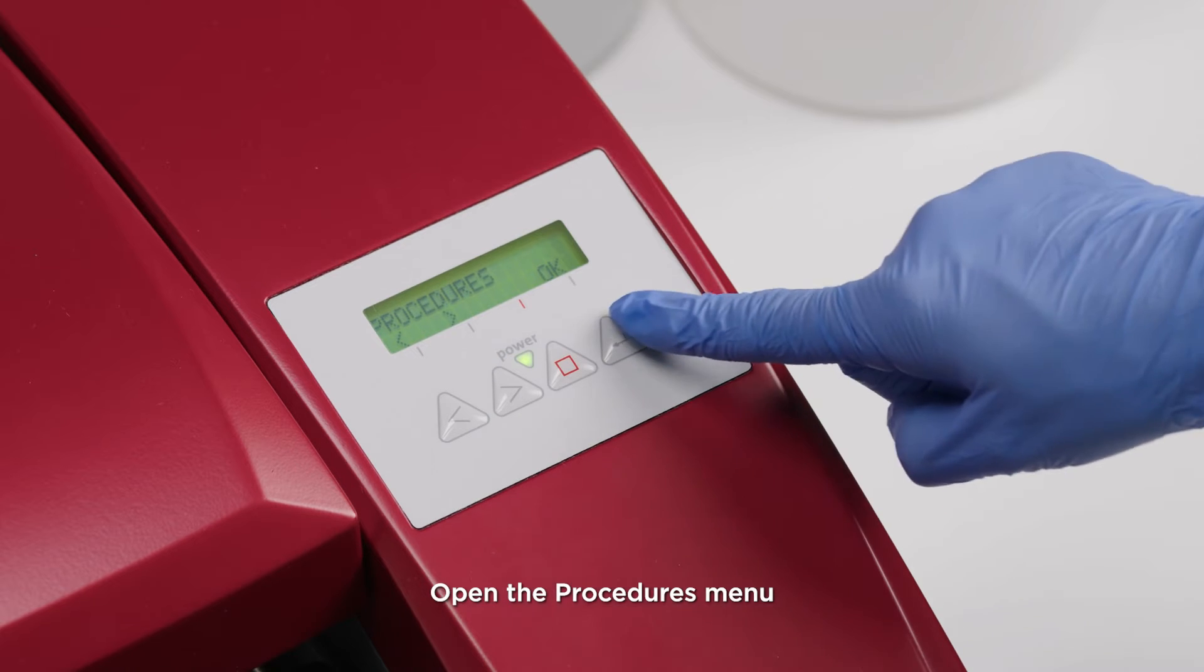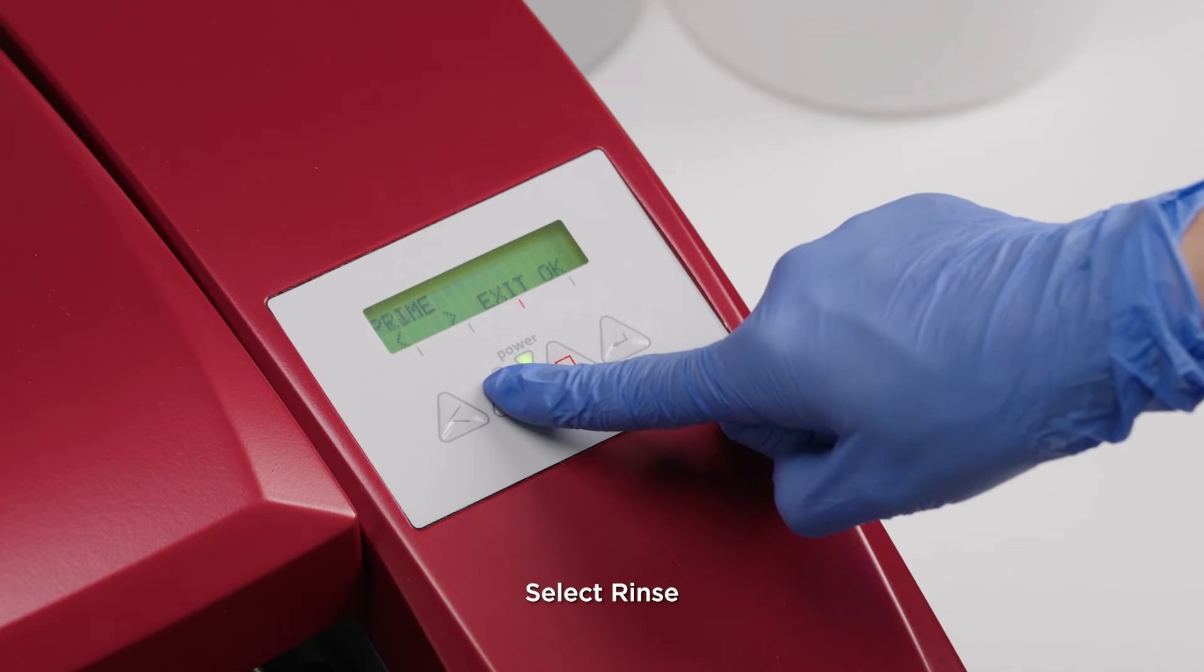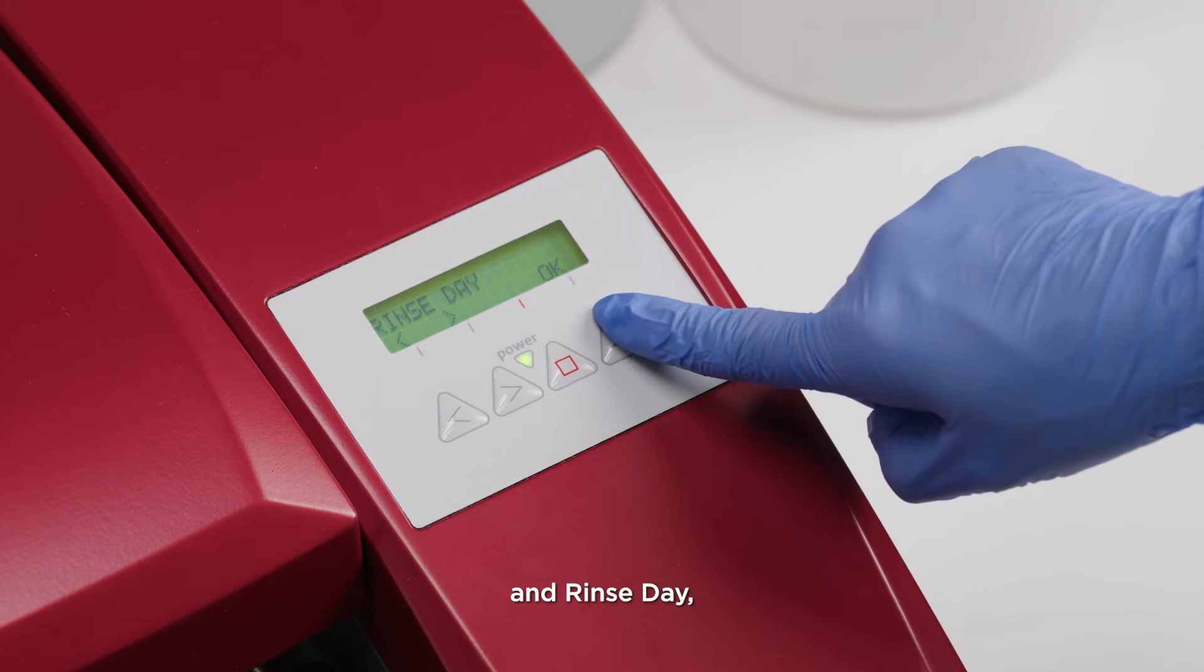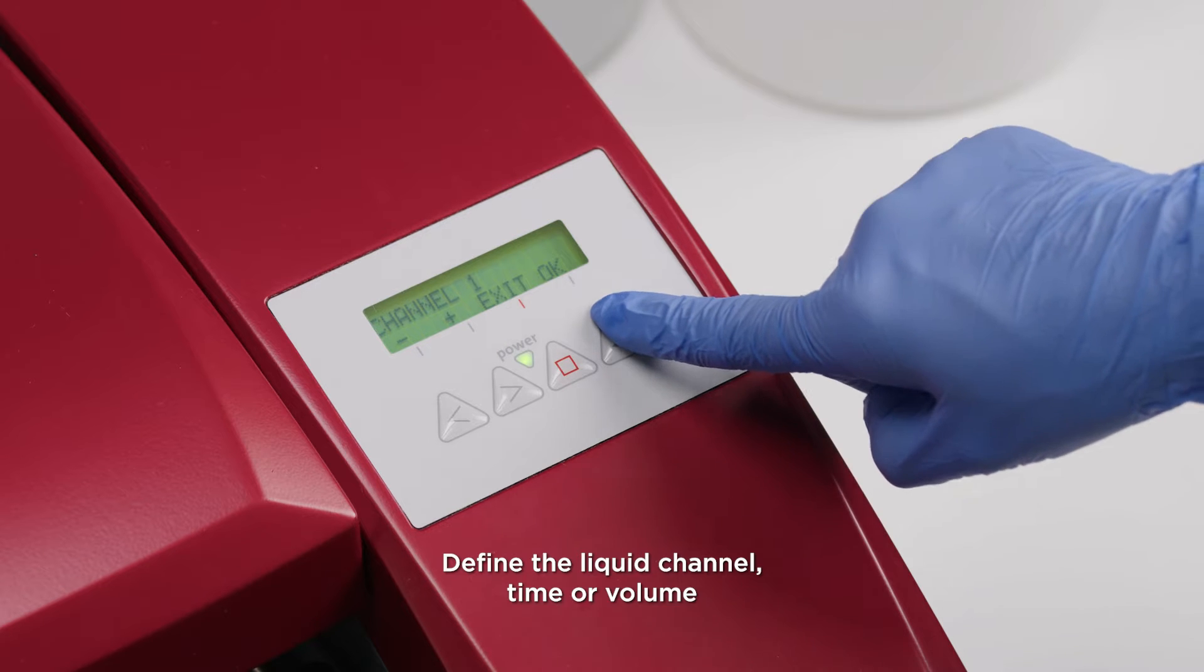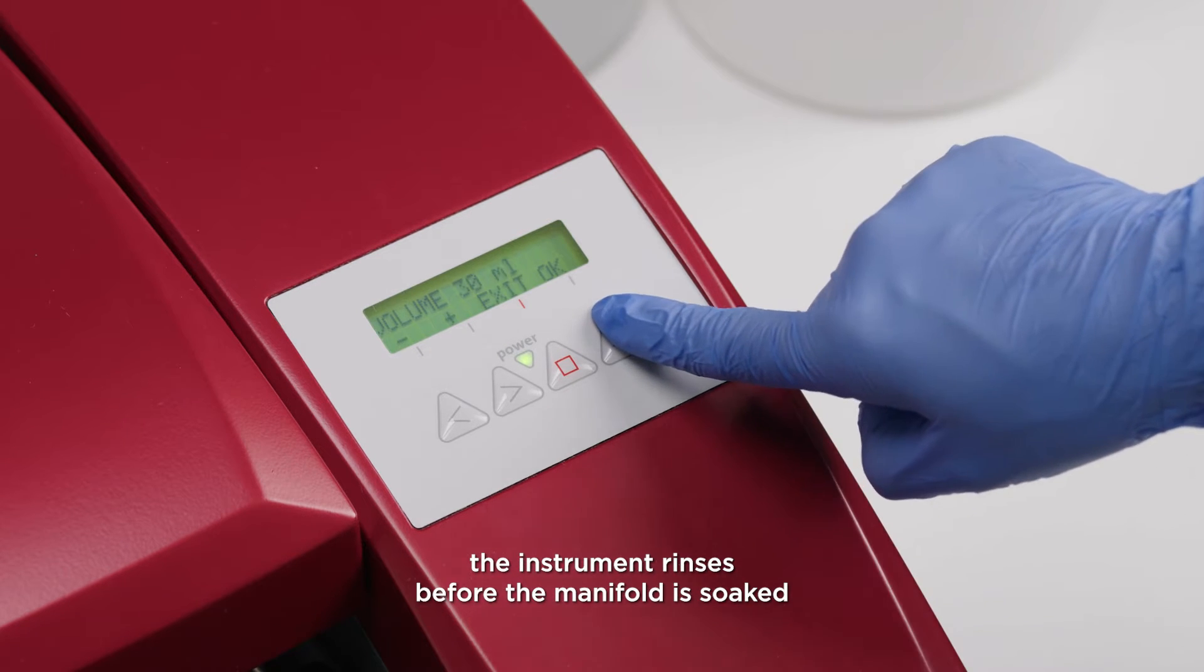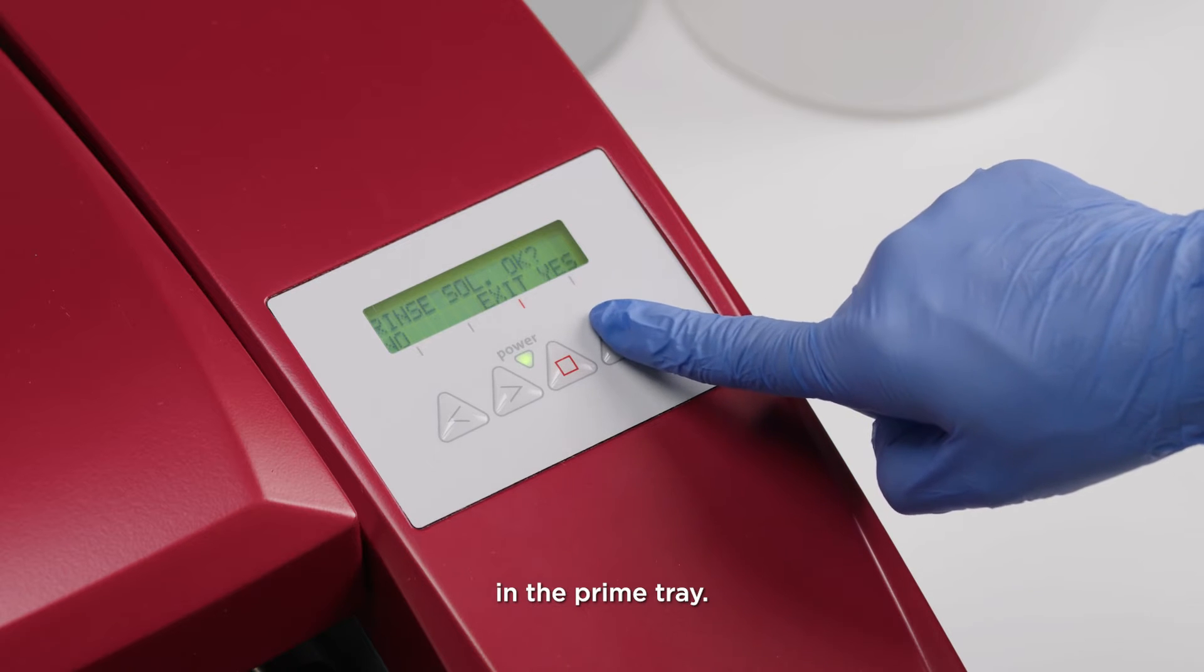Open the procedures menu. Select rinse and rinse day to rinse with buffer or distilled water if the instrument will be left standing for up to two hours during the working day. Define the liquid channel, time or volume the instrument rinses before the manifold is soaked in the prime tray.